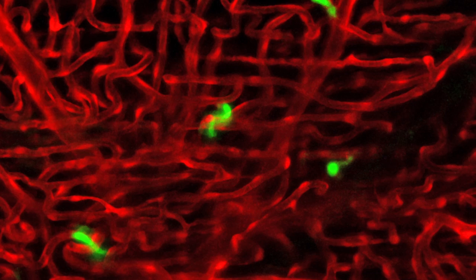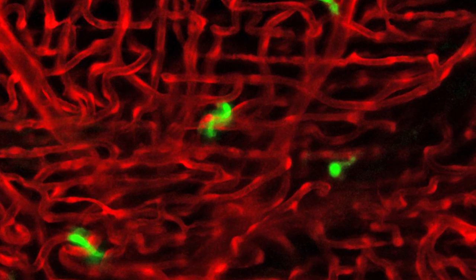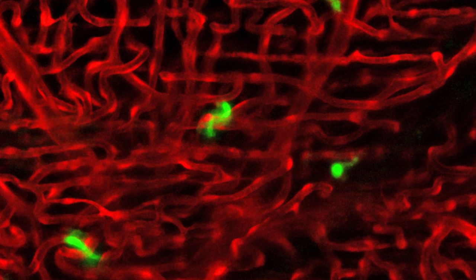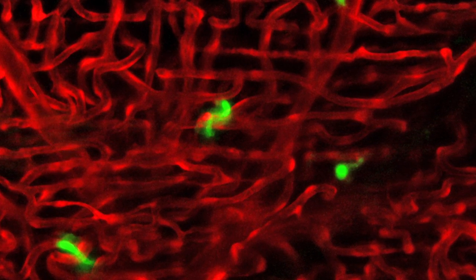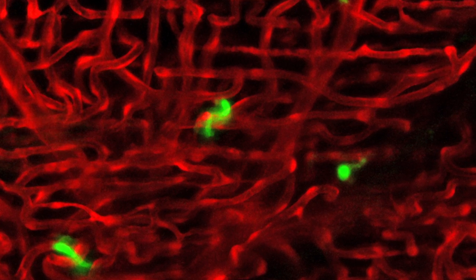I guess my favorite part of this image is just the fact that the tumor cells are really clearly taking the shape of the vessel, that you can see there are all of those tortuous, narrow blood vessels, and the tumor cells are really lodged in there, and you can see that they're twisting around as well with the blood vessels.